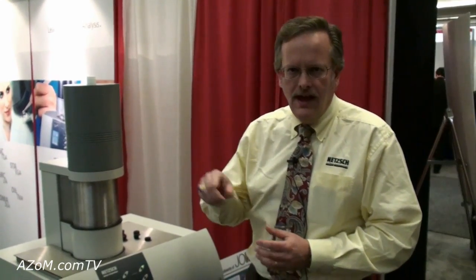Thanks for telling us about the LFA 457. And if anybody wants any more information, go to the website. For worldwide, it's www.netzsch.com, and in the United States, there's a website at e-thermal.com — that's for the U.S. audience.